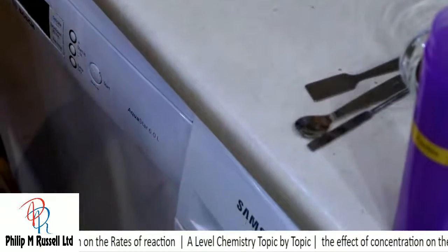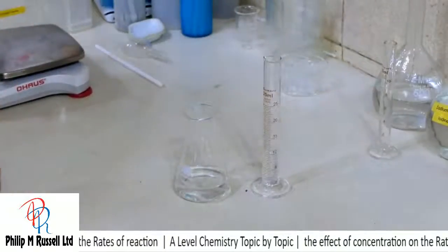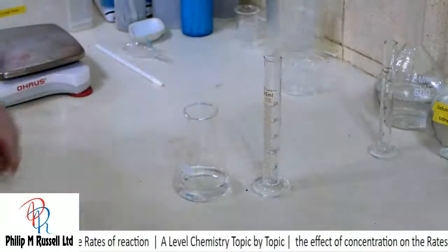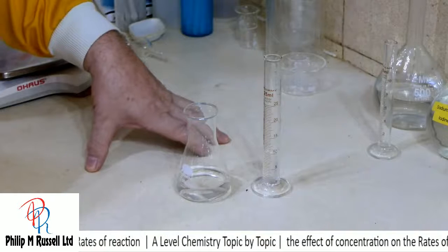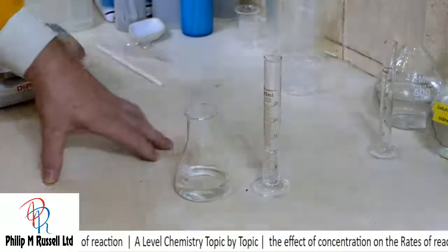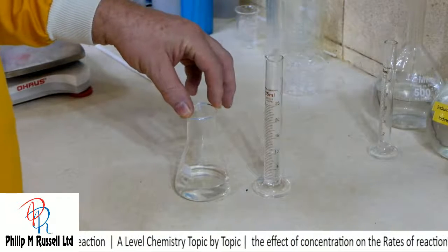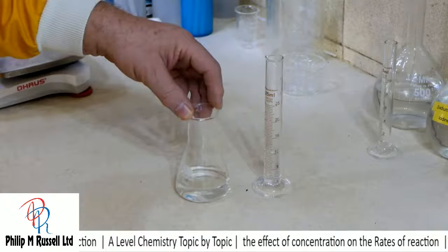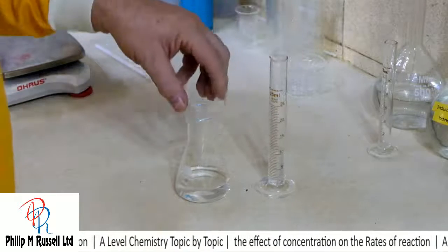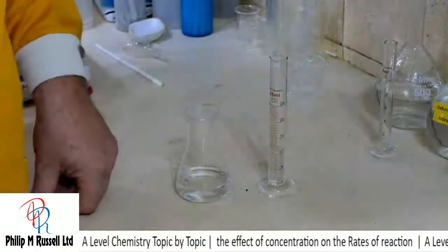So we've got two clear solutions, and what we need with this is just one extra little toy, the clock. And what we're going to do is we're going to add this to this, and we're going to just see how long this is going to take when we add one to the other, and we'll just measure that.